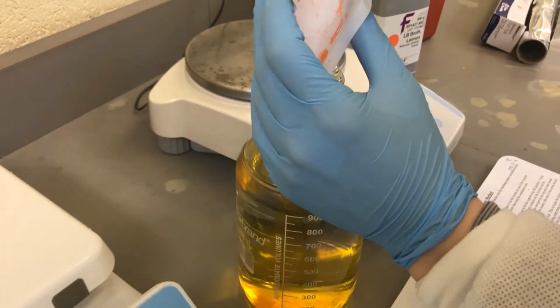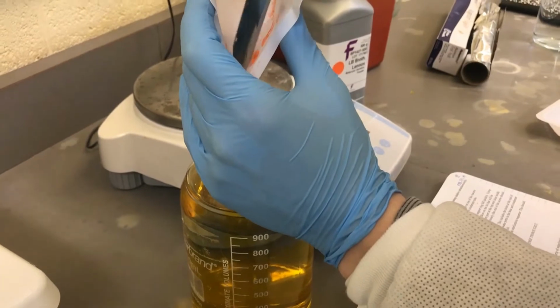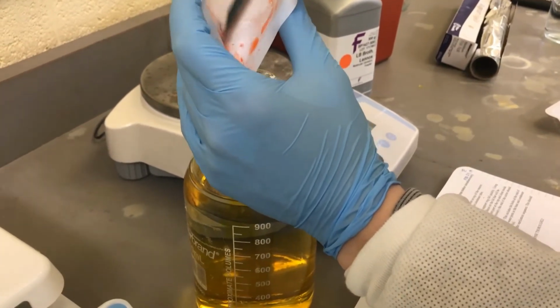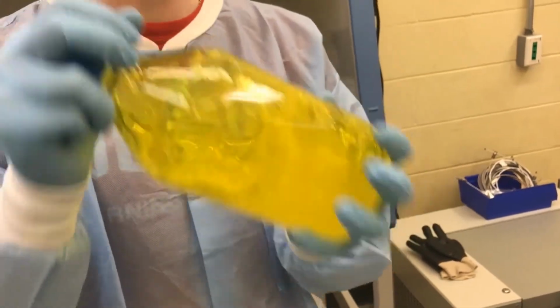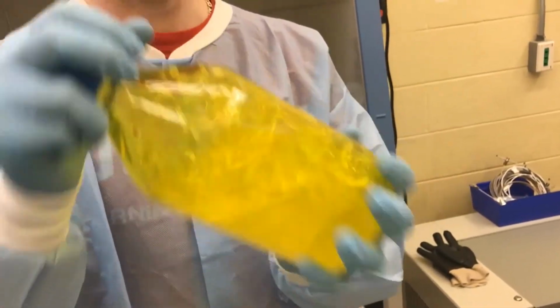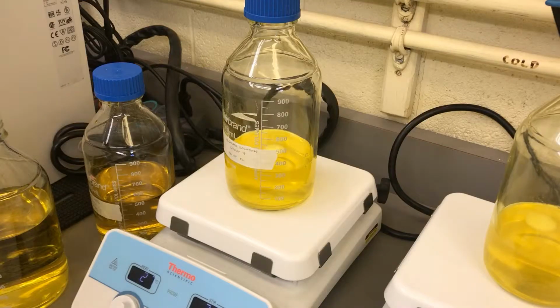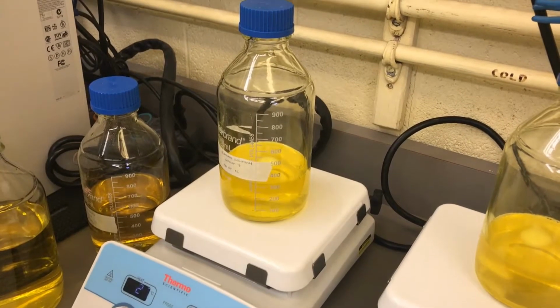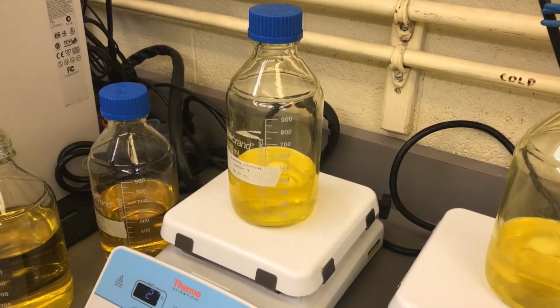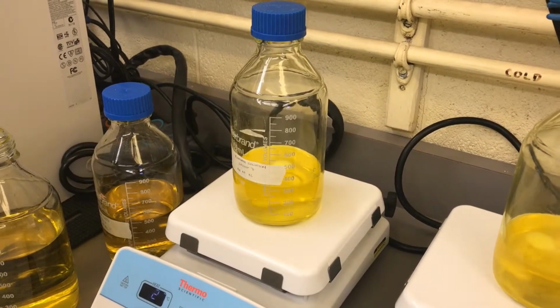The first step in this experiment is preparing the solutions. First, measure out a half a gram of tartrazine and add it to 1 liter of deionized water. In a separate container, add 3 grams of alginate to 300 milliliters of the tartrazine solution and shake vigorously. This can be put aside with a stir bar to continuously mix until the next lab period, as it will take a while to fully dissolve.